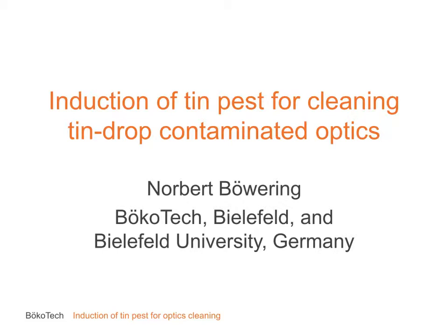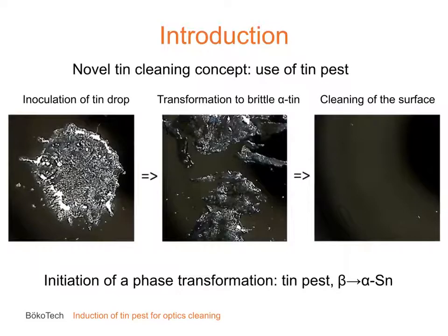Contaminated Optics. My work is about the cleaning of tin drops on very sensitive optics by initiation of a phase transition. The main idea is to make a tin drop that fell on a coated mirror become very brittle so that its pieces can easily be removed by gentle puffs of dry gas. This scheme is illustrated in the photos shown here.